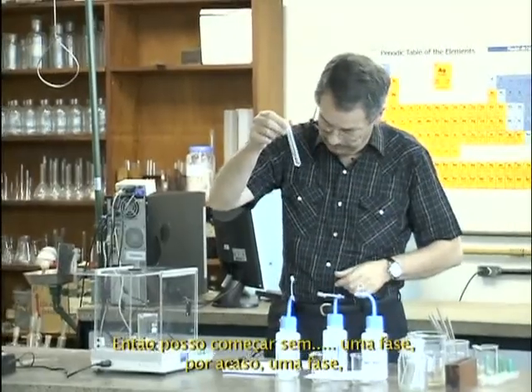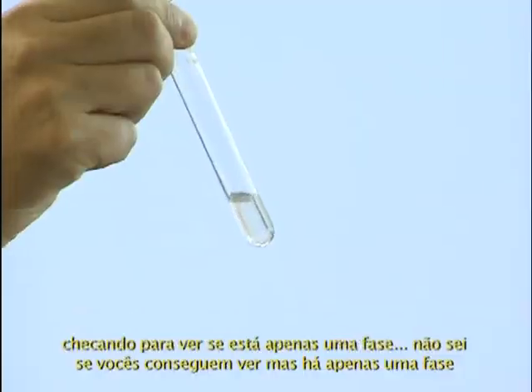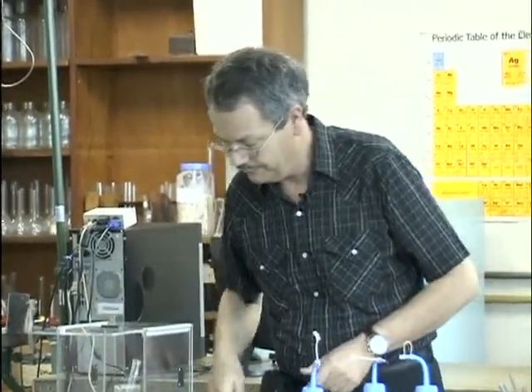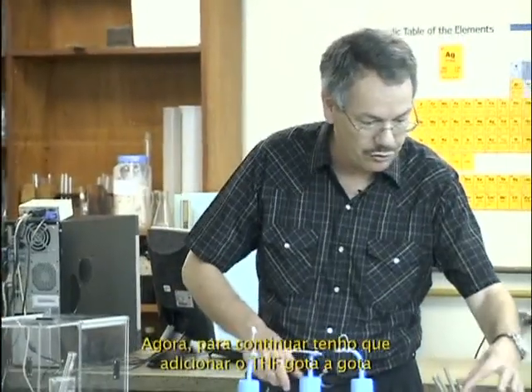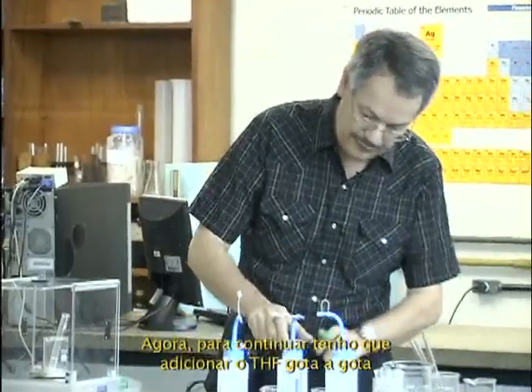By the way, you can check it's one phase. I don't know if you see it, but I do see it. It's one phase. Waiting. I have 105. Now to go on, I must add THF dropwise.